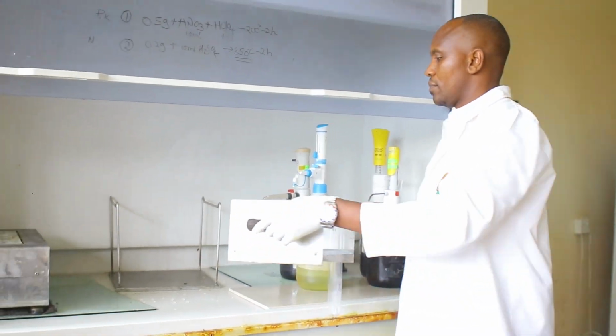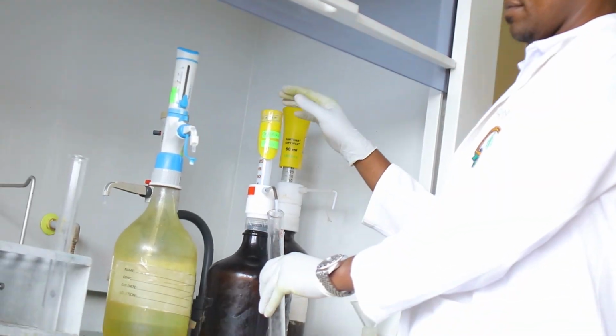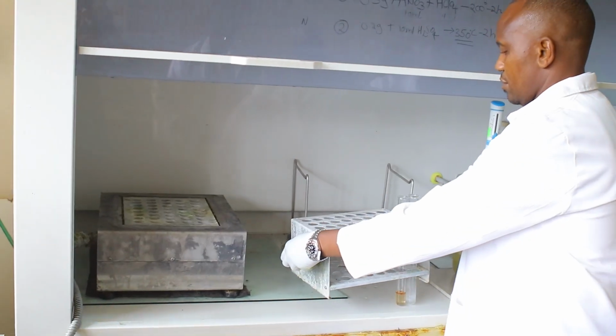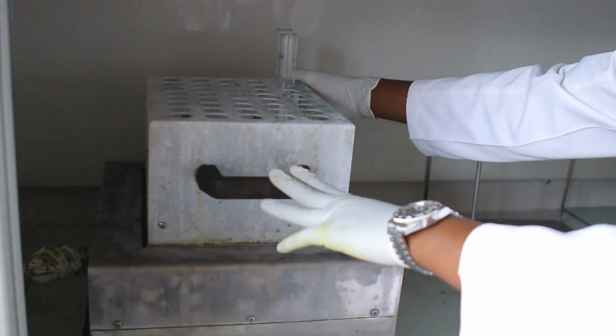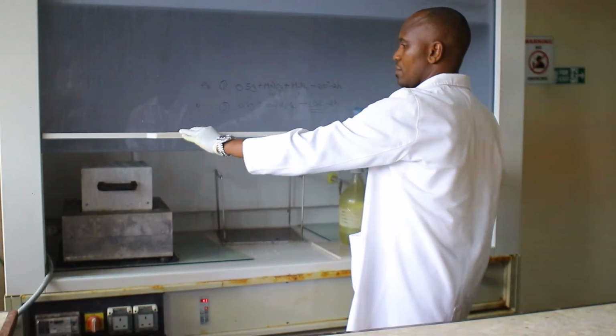The reason why we are analyzing this is to ensure that, of course, we are protecting food safety. We are promoting food safety in the country as the mandate of Kenya Plant Health Inspectorate Service. Because, as you know, heavy metals bioaccumulate and they are harmful to the environment, but also for human consumption.